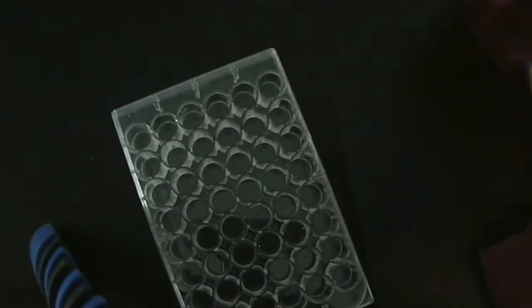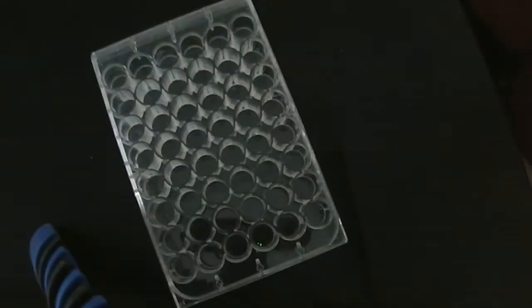So let's pick a set of 3, and we'll test all the different options as far as what goes in first. Okay? Luminol, bleach, and hydrogen peroxide. Okay, so I'm going to start with the order that we just said: luminol, bleach, and hydrogen peroxide. And then I'm going to do luminol, hydrogen peroxide, and bleach. And then I'm going to do bleach, hydrogen peroxide, and luminol.